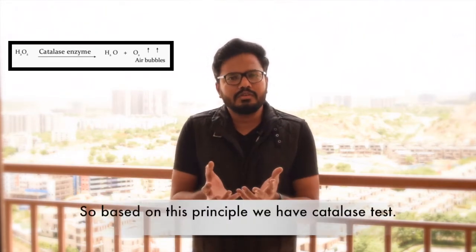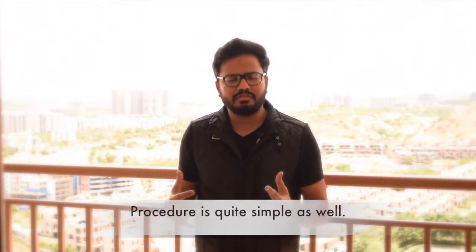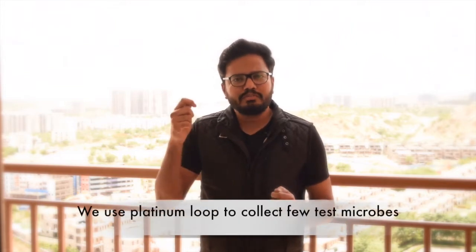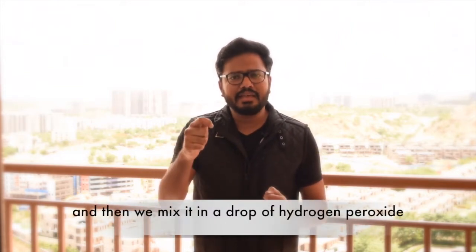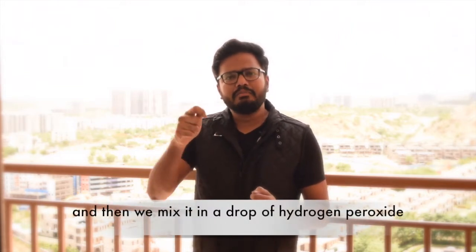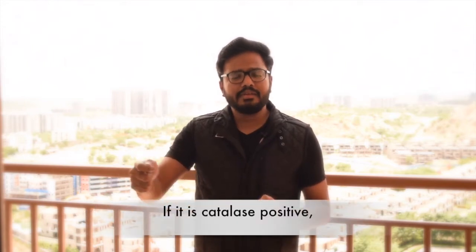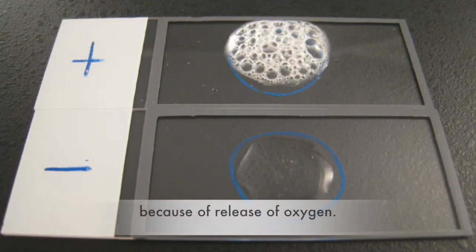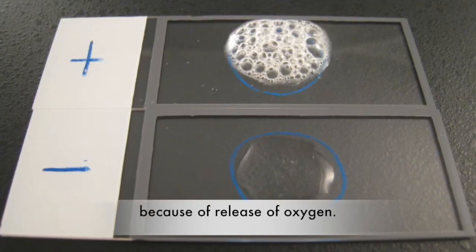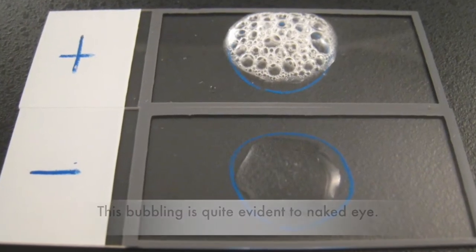Based on this principle, we have the catalase test, and the procedure is quite simple as well. We use a platinum loop to collect a few test microorganisms, then mix it in a drop of H₂O₂. If the reaction is catalase positive, there is immediate bubbling because of the release of oxygen, and this bubbling is quite evident to the naked eye.